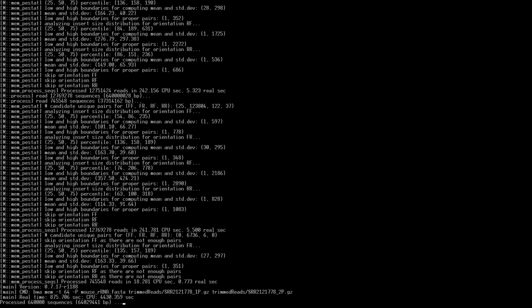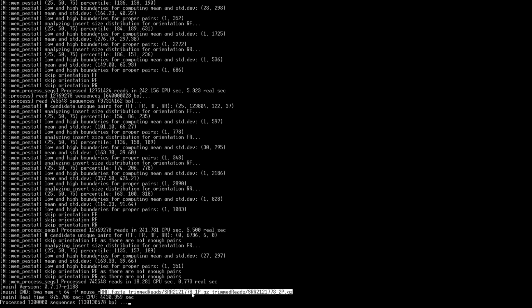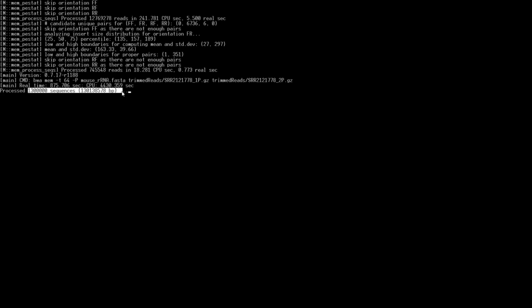Oh, that's the BWA output. So this isn't from Kraken, this is from BWA. Basically, it's saying that for 778 now, 778, that one is finished. So now it's going to go on to 779. Here is Kraken.